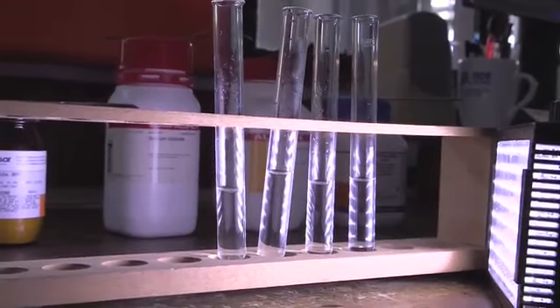When I was a student, in fact, when I was at high school, we had to do analytical chemistry trying to identify different ions like bromide, iodide, chloride, and we did all sorts of tests. So I thought it'd be quite fun to get Sam to do one of these tests. These tests look really quite pretty, though when I was a schoolboy I found them really tedious.